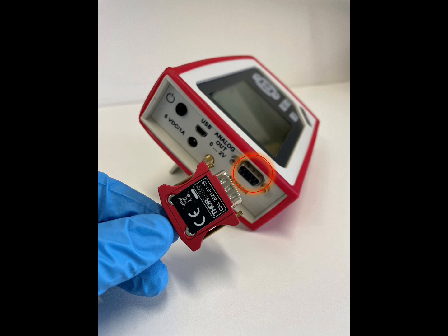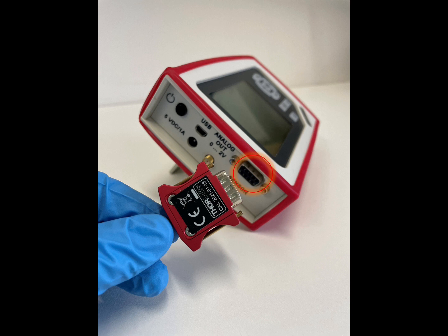Plug the powermeter sensor into the powermeter. For the model presented here, it is enough to push the plug with the pins into the corresponding interface. No screwing needed.